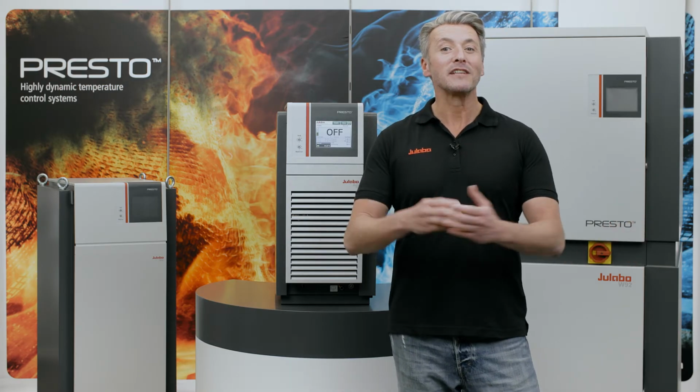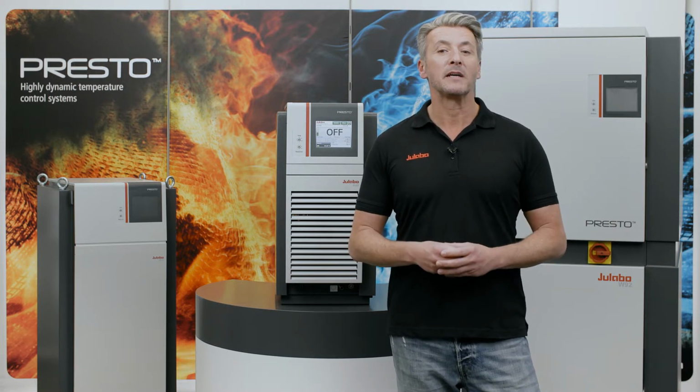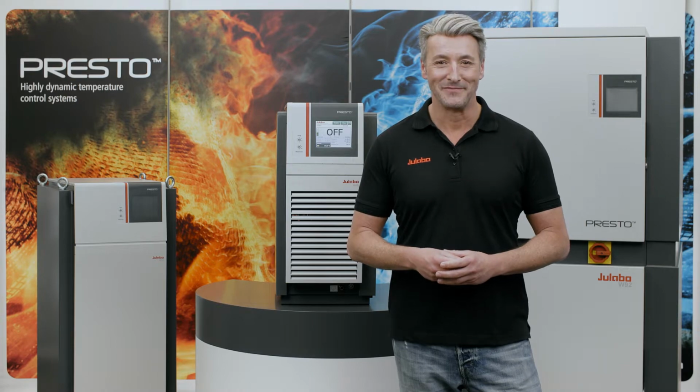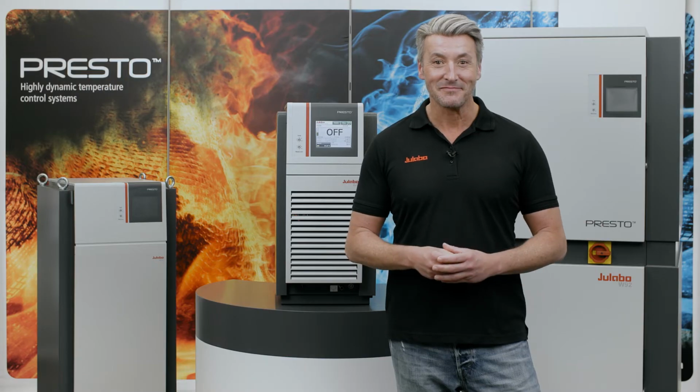My name is Alex and today I will show you how easy it is to set the safety settings for our highly dynamic temperature control systems, PRESTO. This setup is absolutely crucial for safe and efficient temperature control and perfect results. Let's have a look at the PRESTO menu.